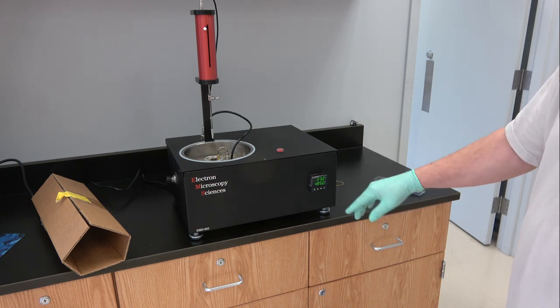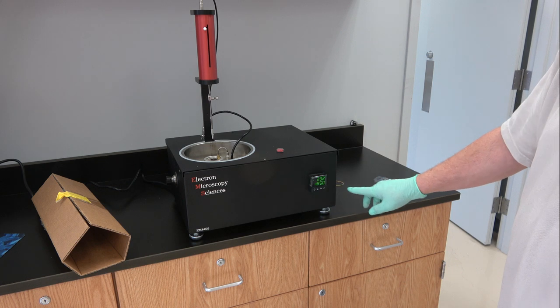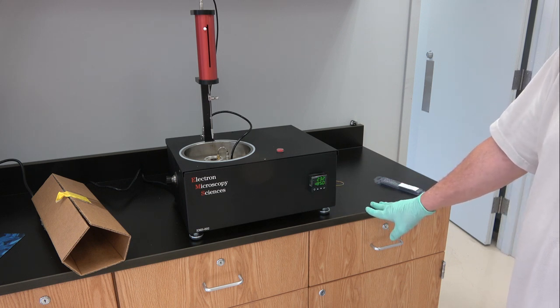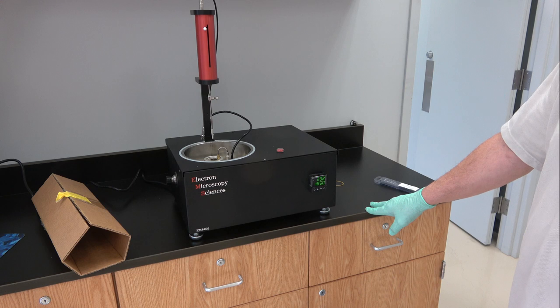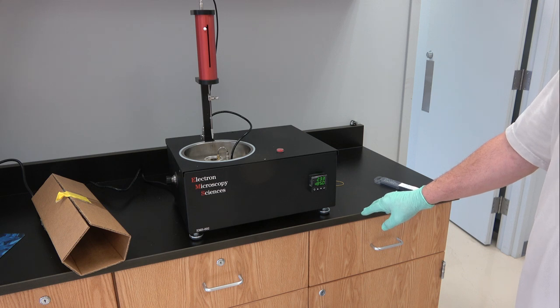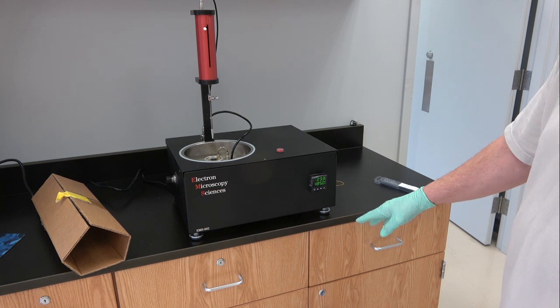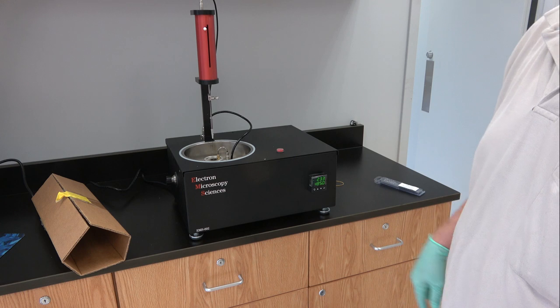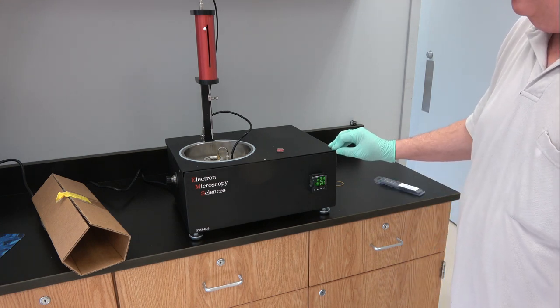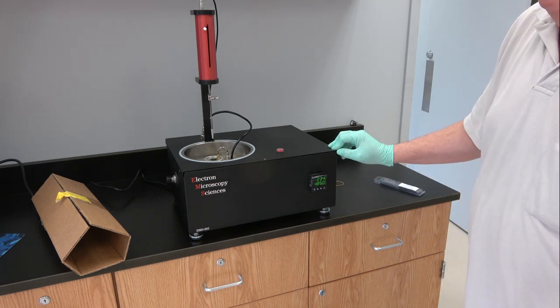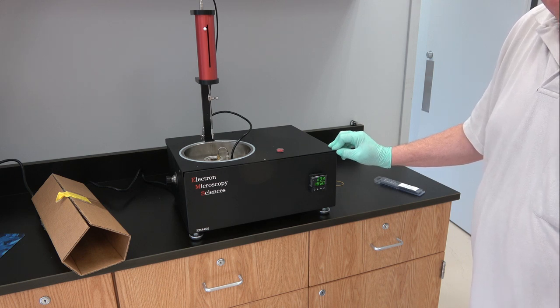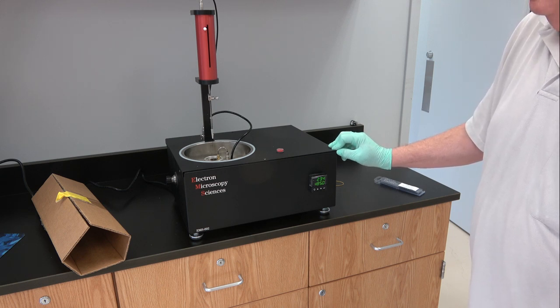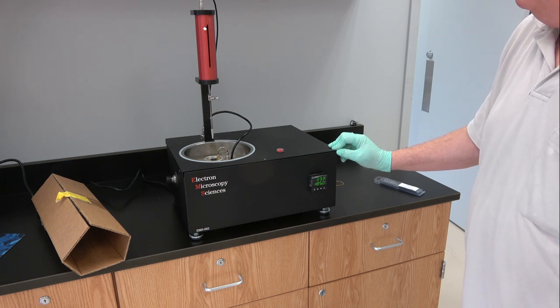The display indicates in Celsius right now the starting value is for very near the melting point of propane. I just set it to minus 185, it's actually minus 184.5. This will allow the controller to maintain the temperature of the cryogen in the condensation chamber so it doesn't solidify with the liquid nitrogen and it's kept at the optimal temperature for freezing.